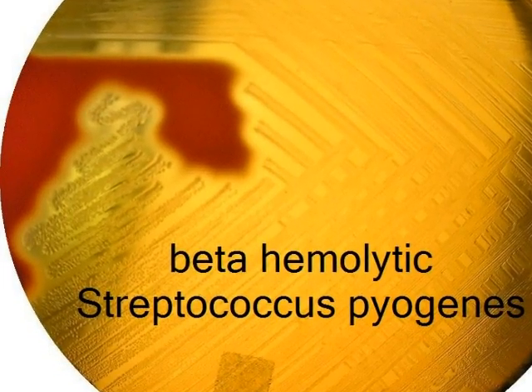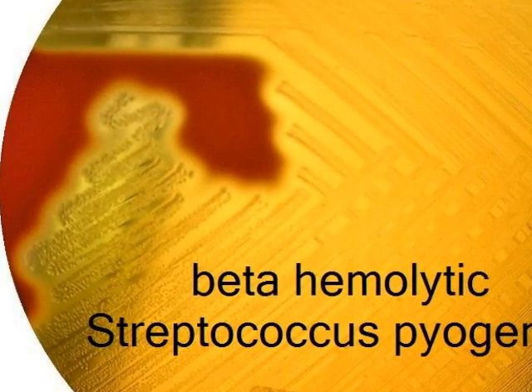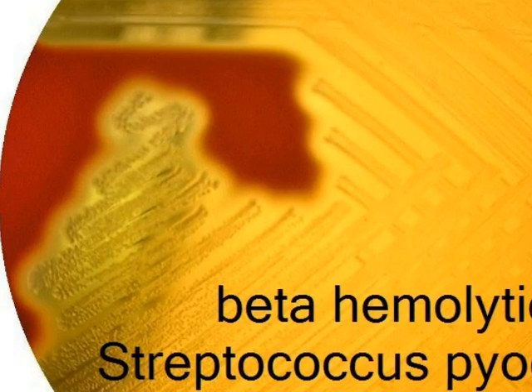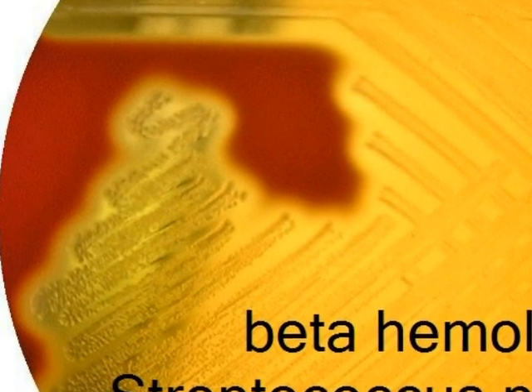Complete lysing of the red blood cells will result in a clear halo around the colony. This is called beta hemolysis. Here we see beta hemolytic Streptococcus pyogenes.